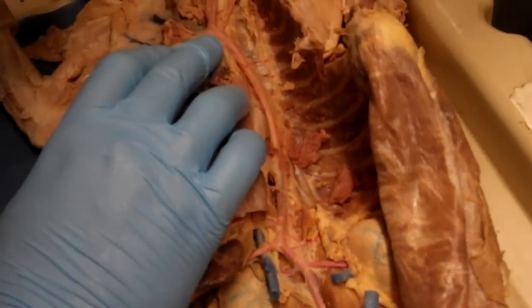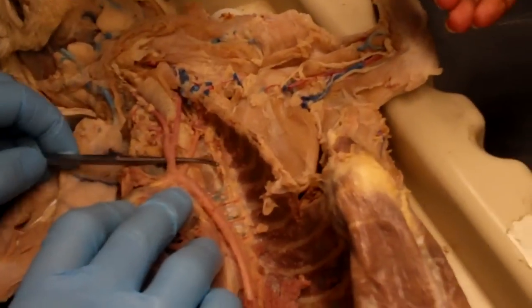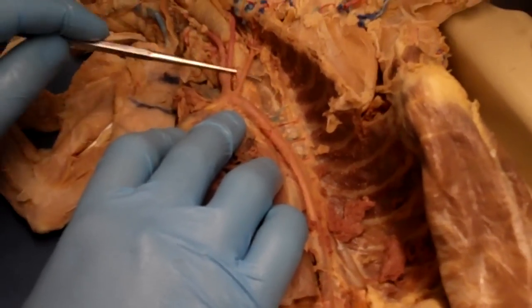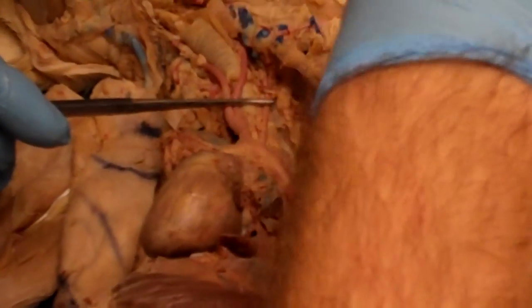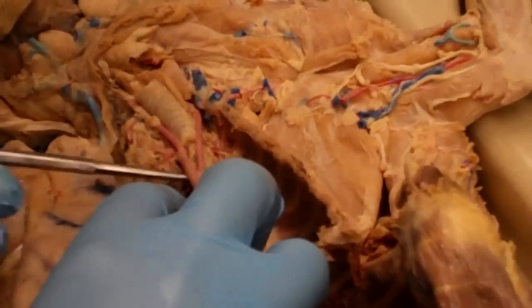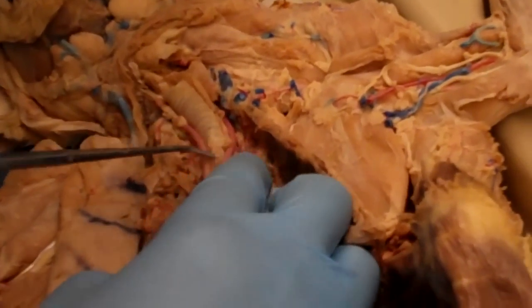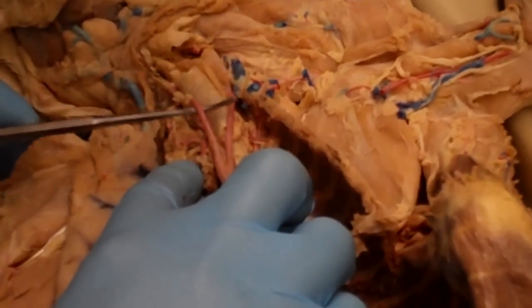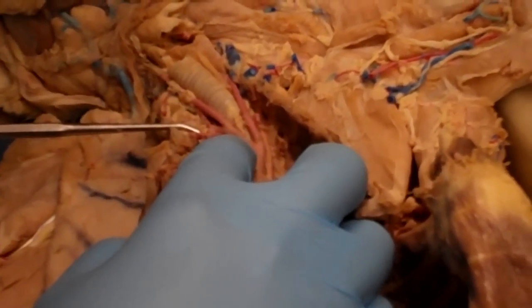From the aortic arch, there were a couple different branches they had you look for. The first branch coming off is going to be the brachiocephalic trunk, and then the second branch coming off is going to be the left subclavian artery. The left subclavian artery is going to go out to the left forelimb. What happens with this brachiocephalic trunk is it'll actually give off two arteries first. It'll give off the left common carotid artery, which is this guy, and then the right common carotid artery, which is this guy. And then the vessel will continue on as the right subclavian artery.